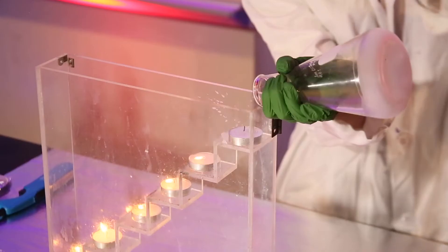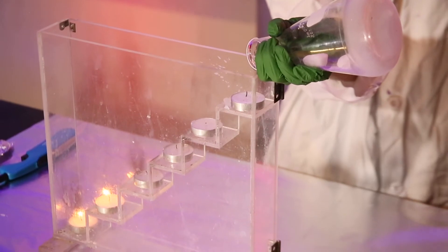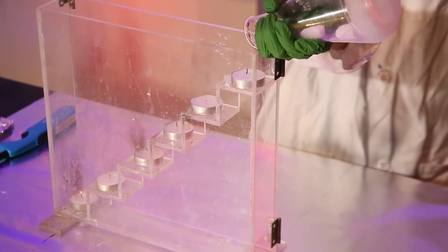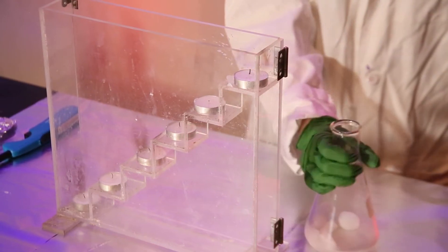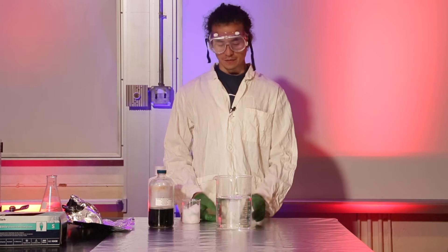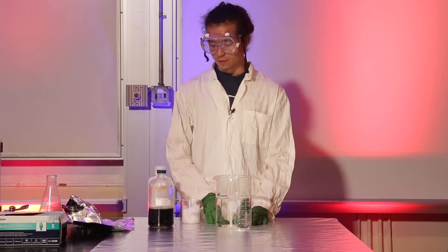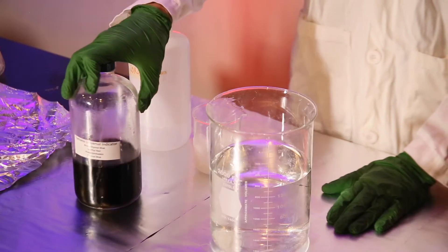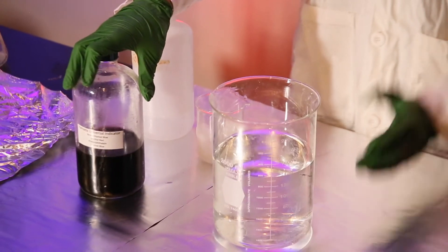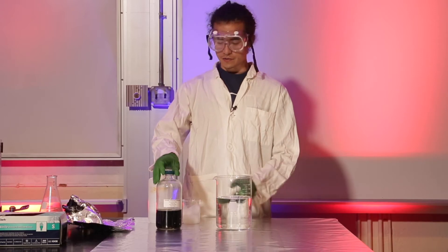Hello, my name is Christian and next we're going to be doing magic ice. So in front of me I have a big beaker full of water and I have an indicator. An indicator is just a way to measure pH visually.